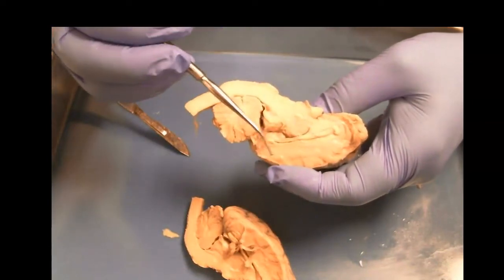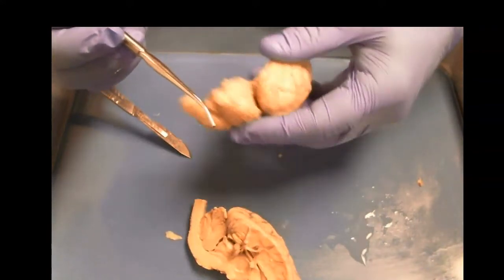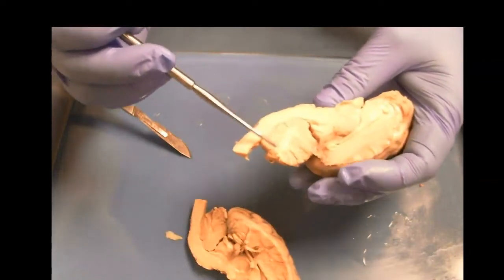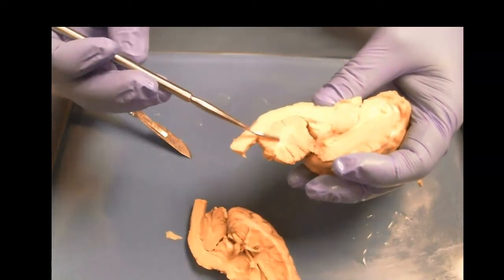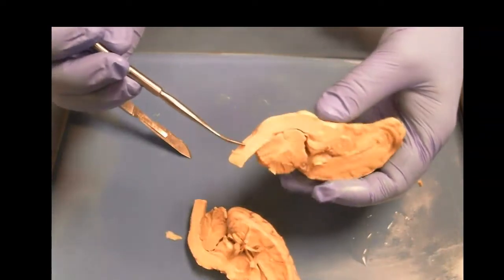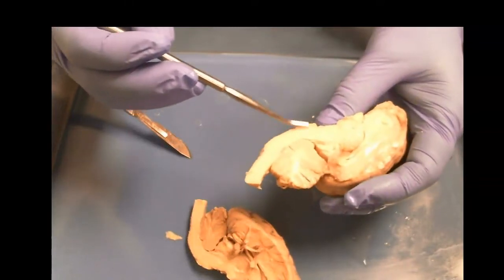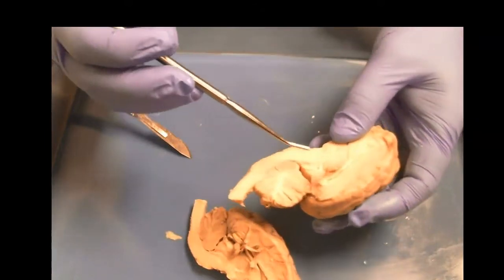So now we're into this part of the brain. This is the sagittal section, and I'm holding this upside down. So let me make it right side up. So here is the surface of the brain, correct side up. Here we have the cerebellum, and inside the cerebellum we can see this nice white matter band. It looks kind of like a tree, and that's convenient because they named it the arbor vitae, which means tree of life. We see the brainstem, this widened area being the medulla, even wider the pons. This little widening is the pons, which means bridge, the basic connection between the thalamus and the rest of the brainstem and the cerebellum.